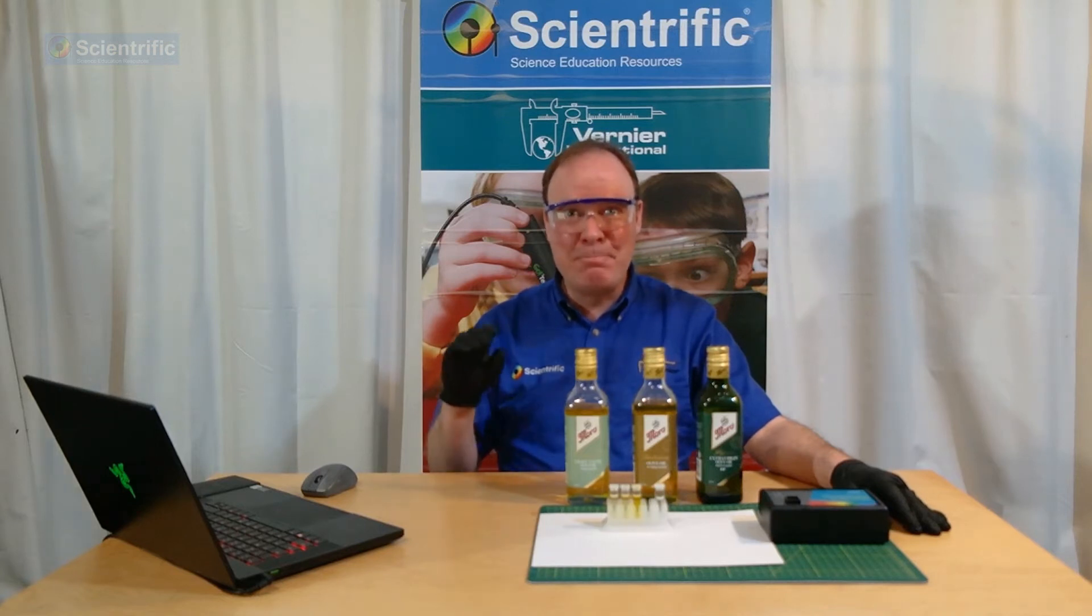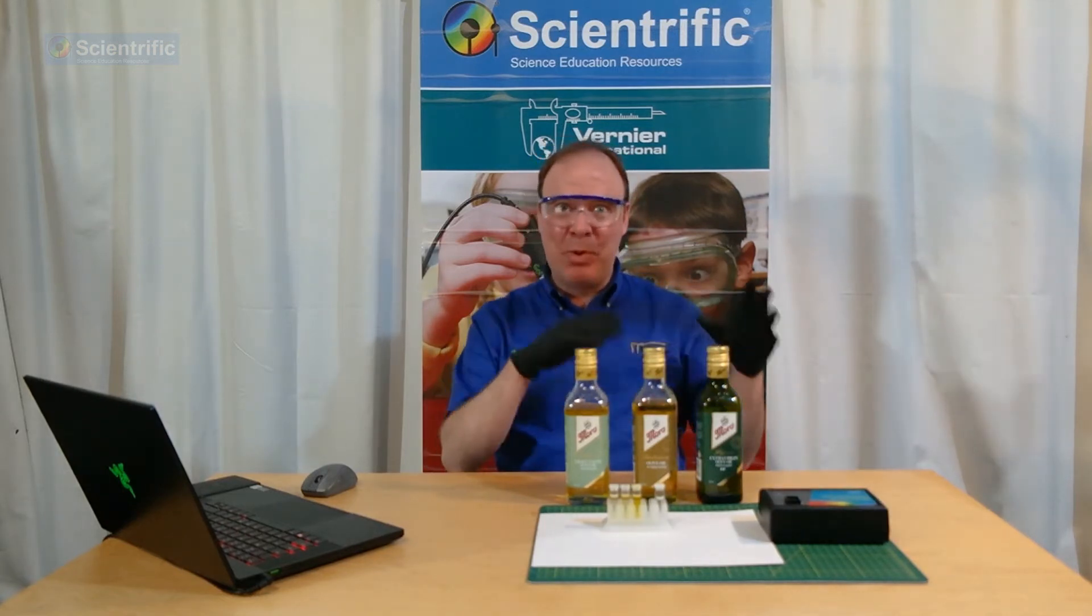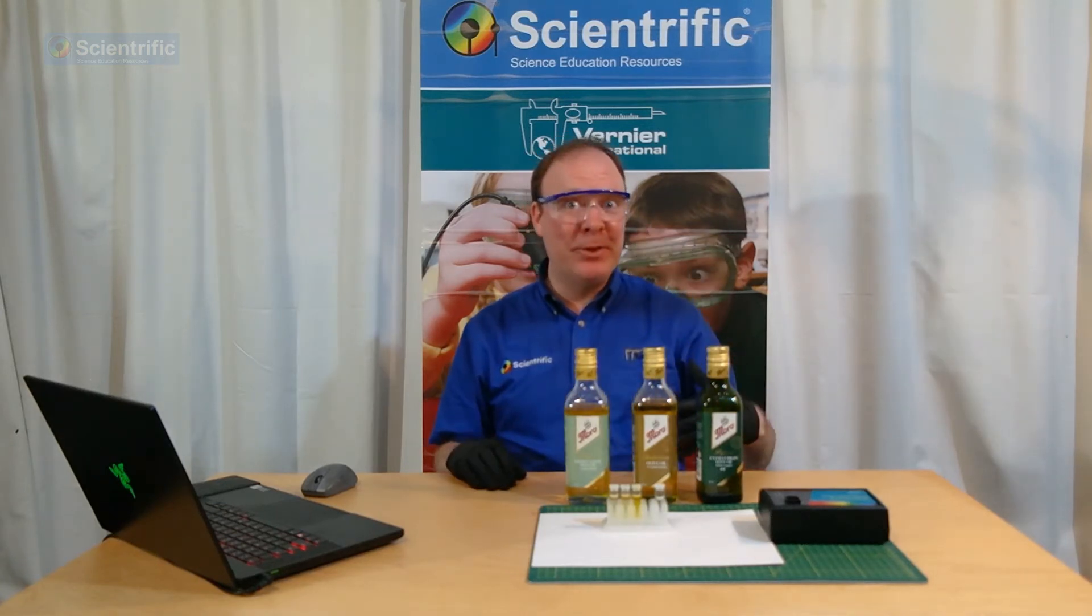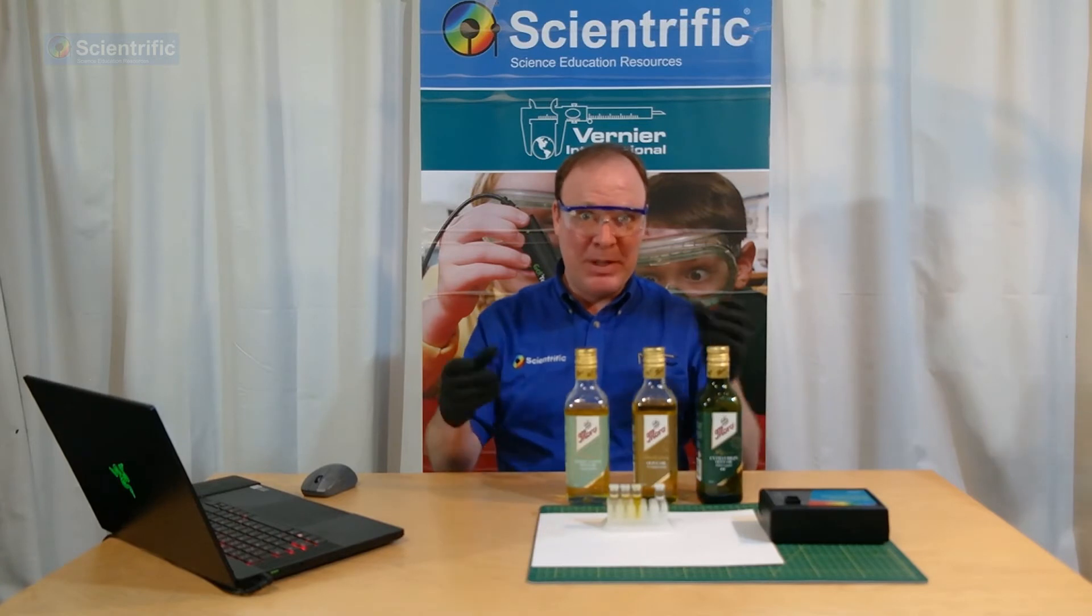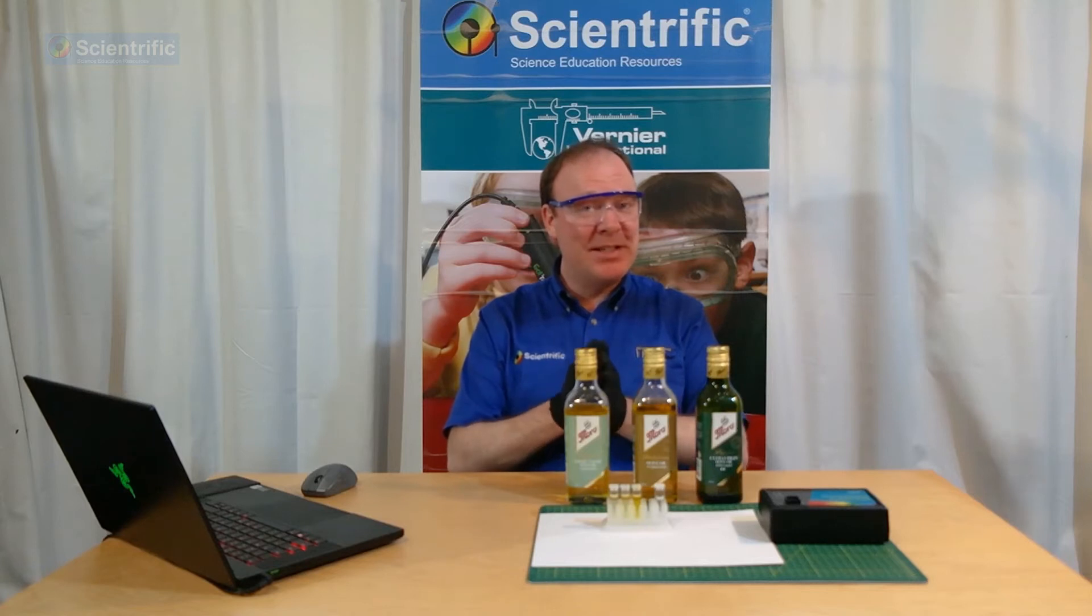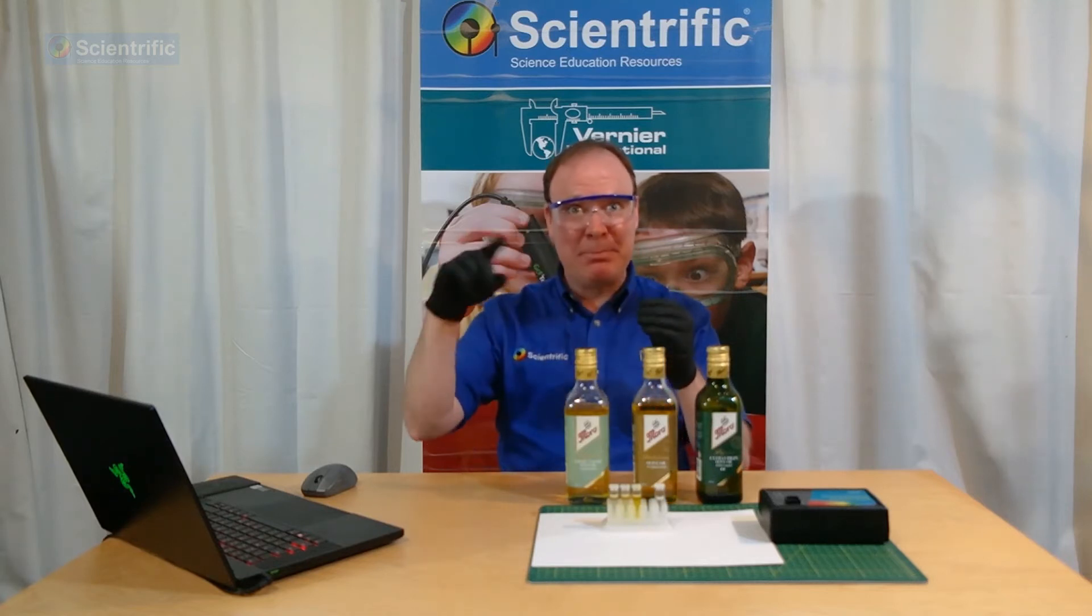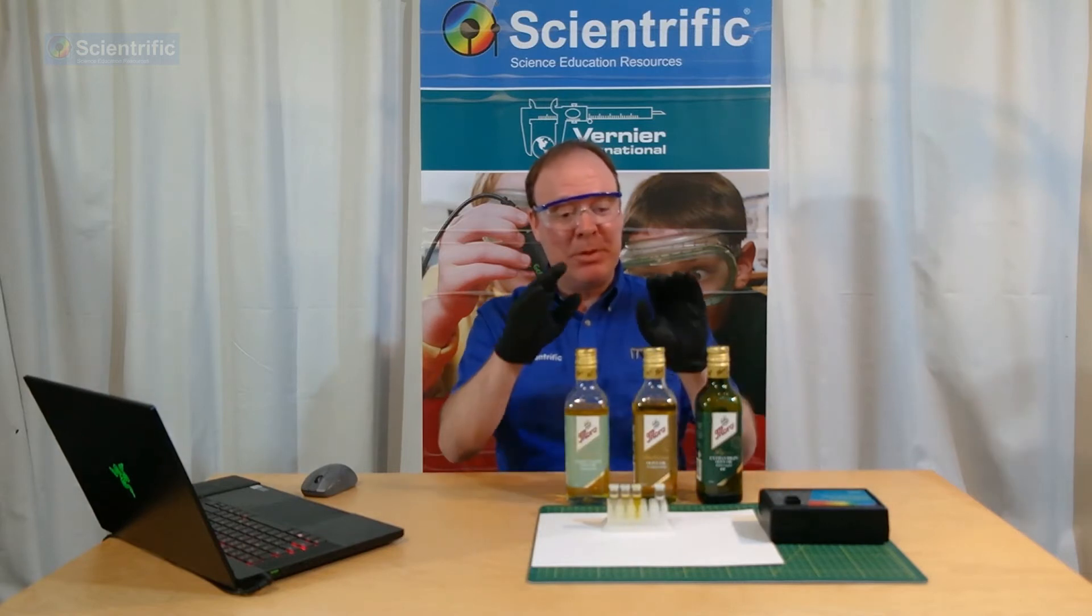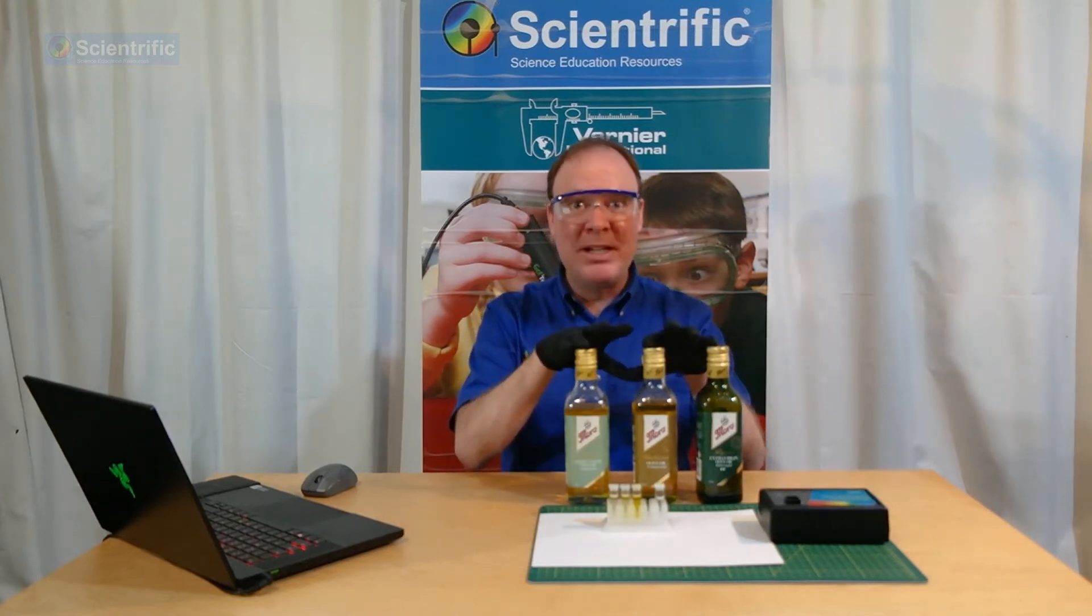Hello and welcome. My name is Stuart Lewis. I'm with Scientrific and today we're going to be doing a slight build on something we did in a previous video. In that video, we looked at the chlorophyll inside spinach leaves using the Go Direct Spectrophotometer to measure that chlorophyll, and we also used fluorescence to look at the specific peaks. Today we'll be looking at chlorophyll again, but this time in different grades of olive oil.